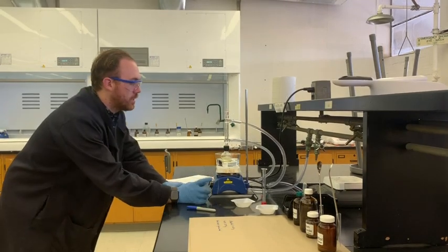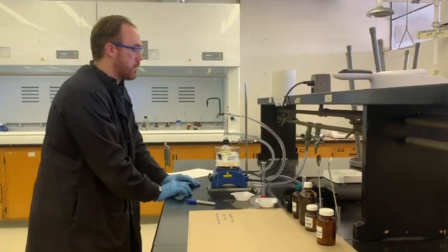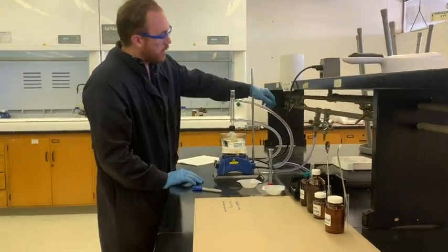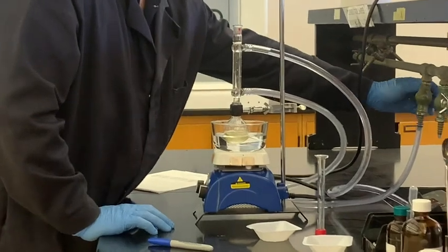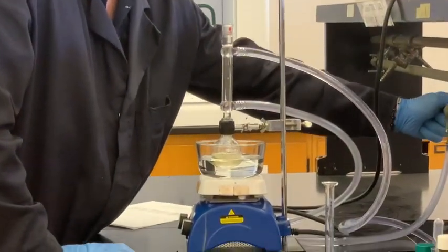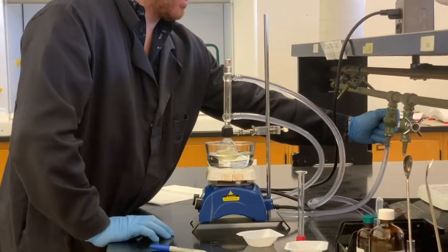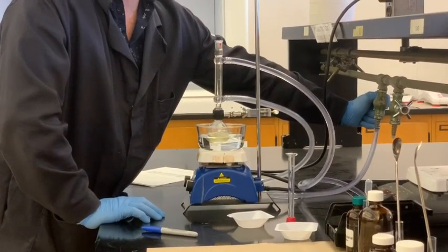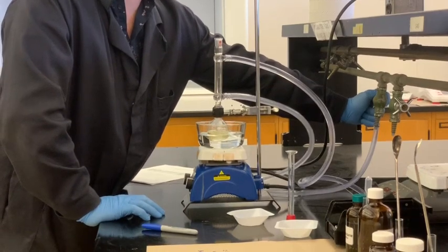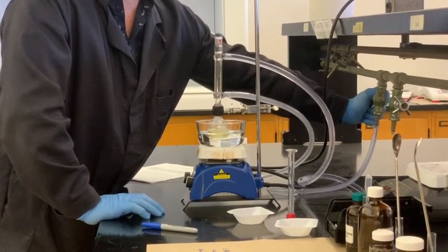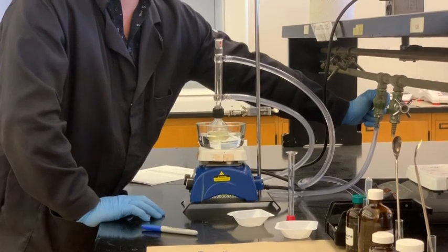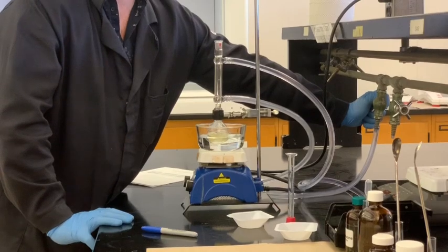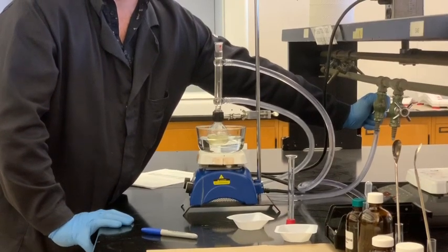So this is a good stirring speed. You don't want it to be too violent or vigorous. You don't want to be knocking stuff up into the reflux condenser. So now we're going to start the water. I always recommend starting the water before you actually turn the heat on just to make sure that you're extra safe. Always keep an eye on the reaction until it actually comes up to a reflux and reaches an equilibrium temperature when it runs pretty steady.